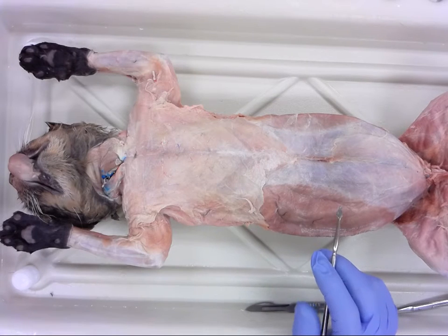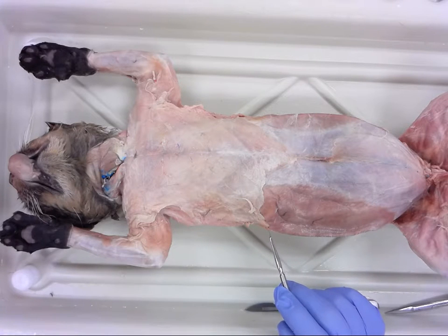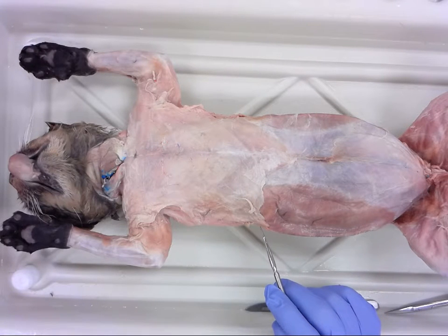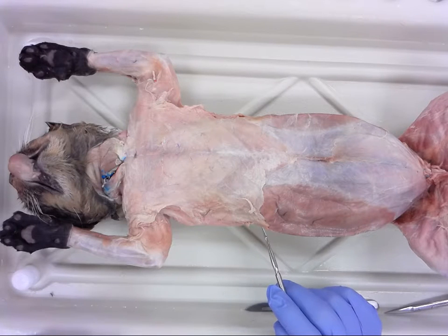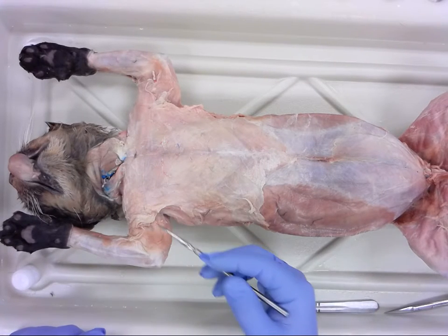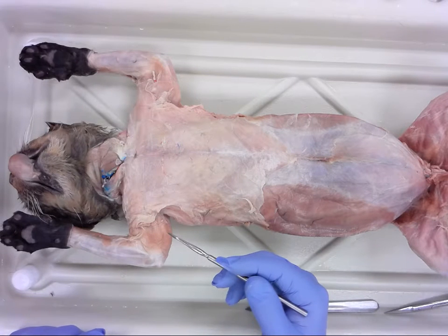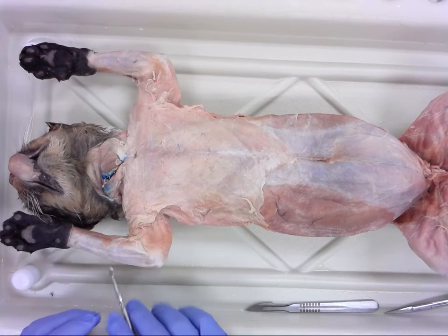From there, we'll progress to the forelimb. I like to get into that fairly quickly because it is one of the more difficult areas for many students because we have smaller muscles. It takes a little bit of dissection to separate them all out, and they also have some long descriptive names, and they can get confusing and jumbled up. So I like to get those early so we have a lot of time to review and go back and see those. You also have your upper arm musculature that you will see mostly in humans as well, bicep, tricep. Once you get into the forelimb, you're going to see the flexors and extensors.